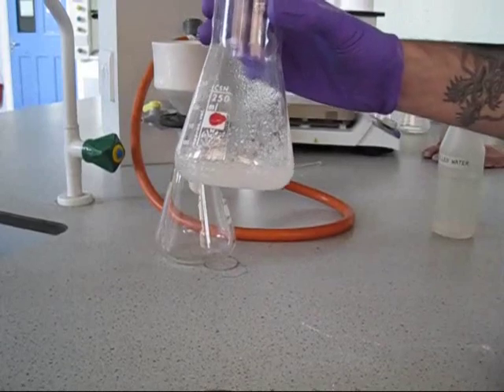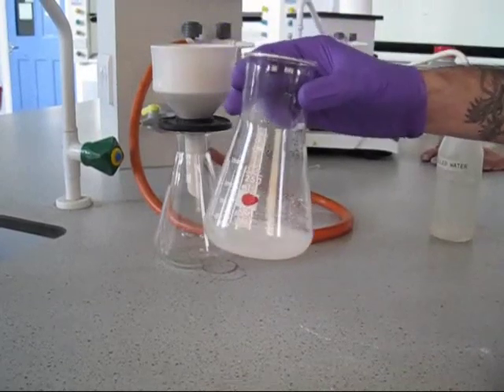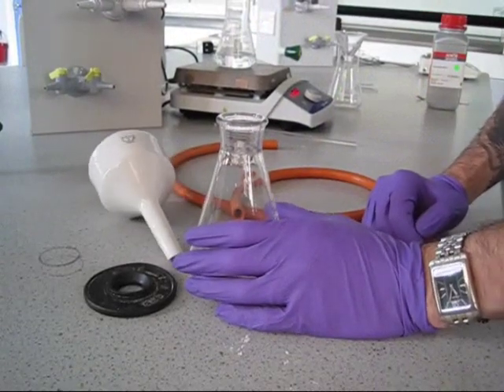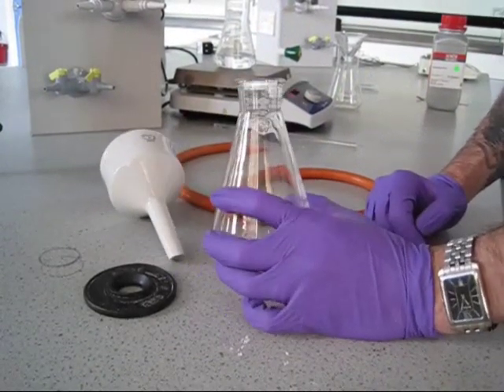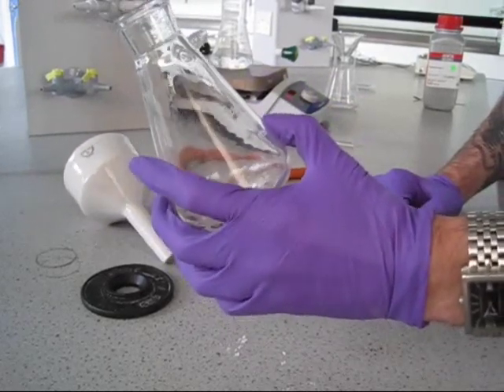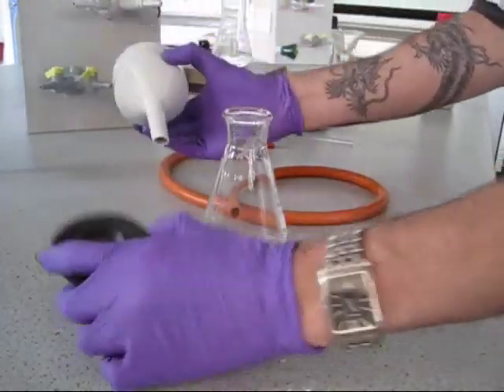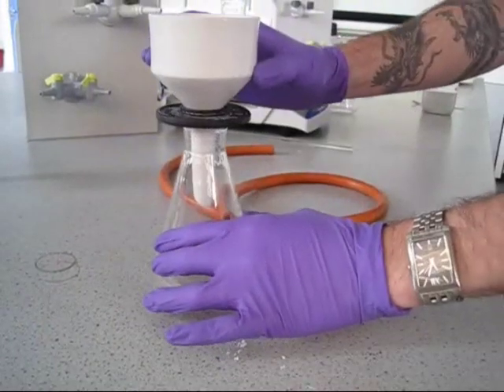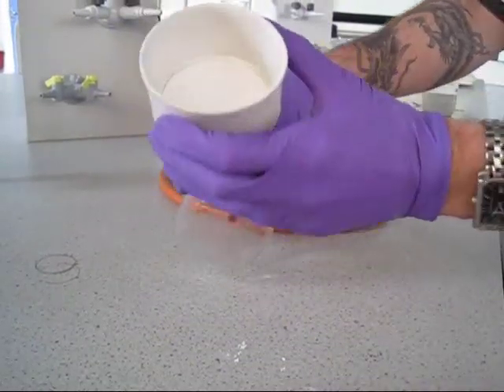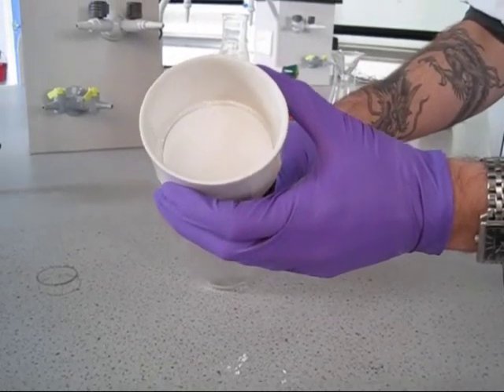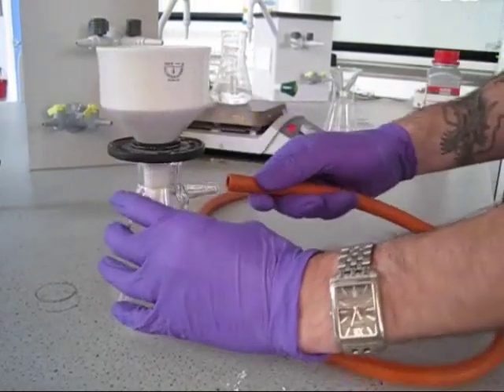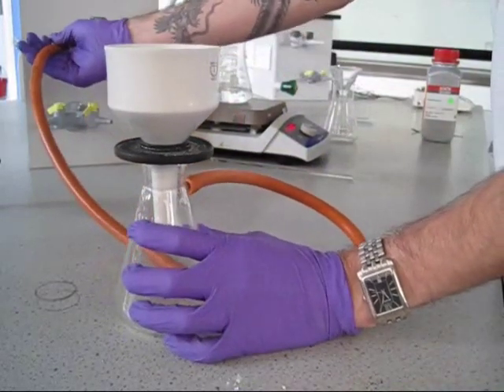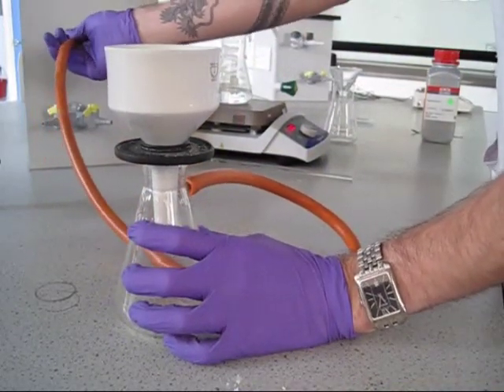Once our product is fully recrystallized, we can now filter it through a Buchner setup. To set up a Buchner filtration, you will need to set up your Buchner kit. You start off with a Buchner flask, a Buchner funnel and a rubber ring, which are put together like so. Place one of the small filter papers inside the Buchner funnel. Attach the vacuum line here and to the vacuum tap on the bench.